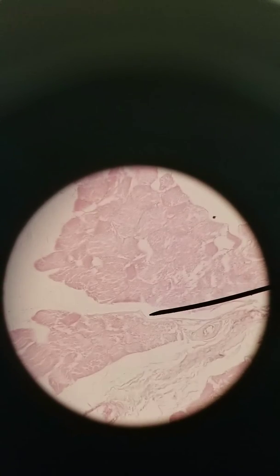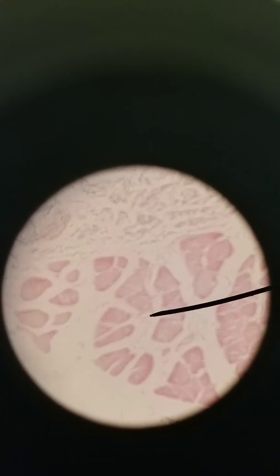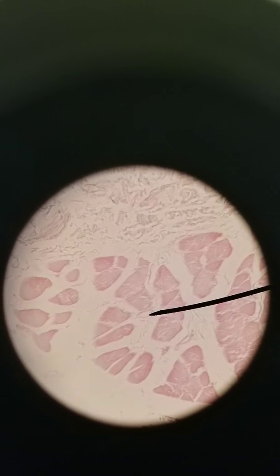What I've mentioned before and what I'm going to continue to stress is don't pay so close attention to the color. I mean, color can be important. Intensity of the color is important, but also the shape. Because this slide shows the staining pretty nicely, but if we go to a different slide, the staining isn't great, but the outlines are really good.